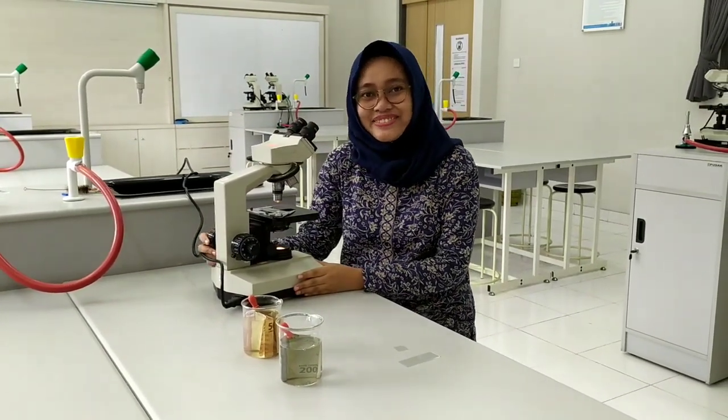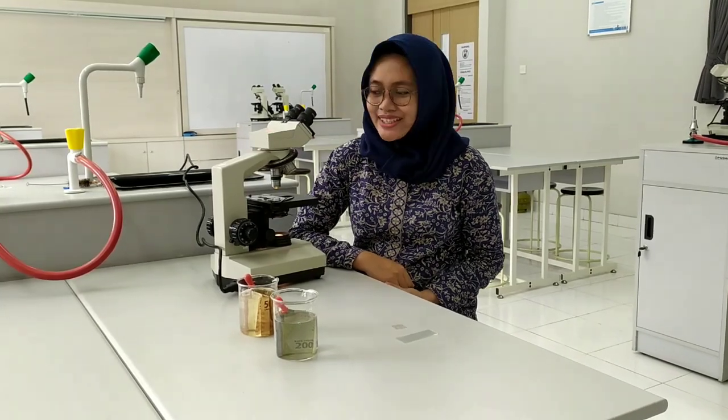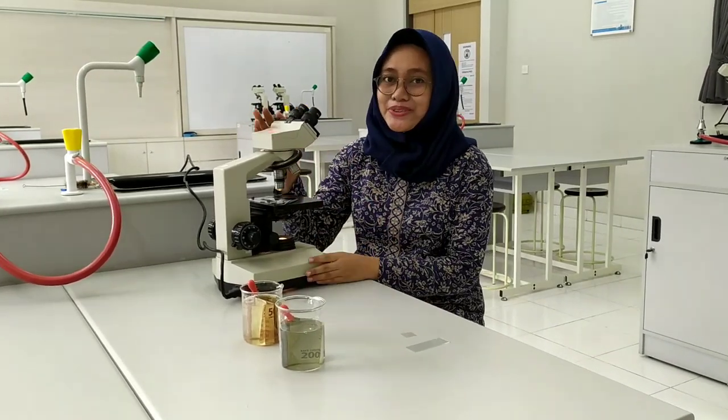Hello, everyone. Good morning. Welcome to science class. Today, we will do an activity using a microscope.